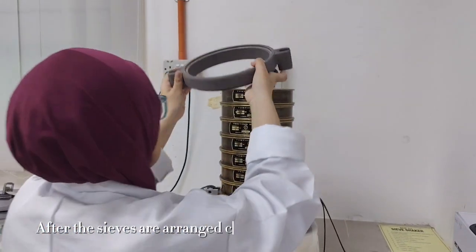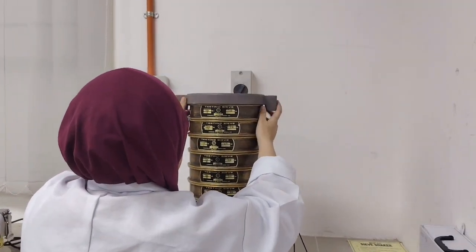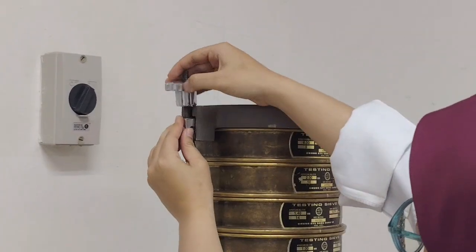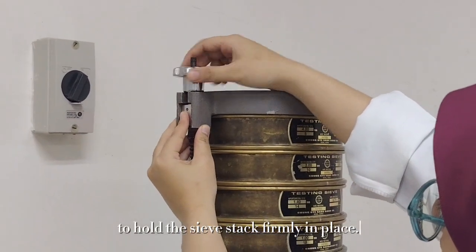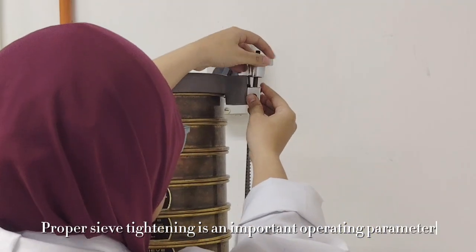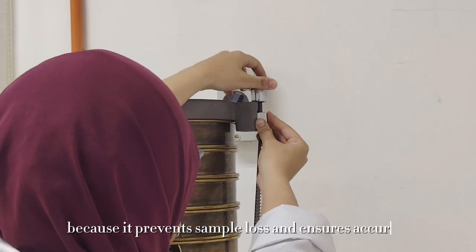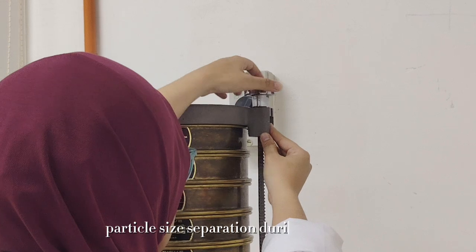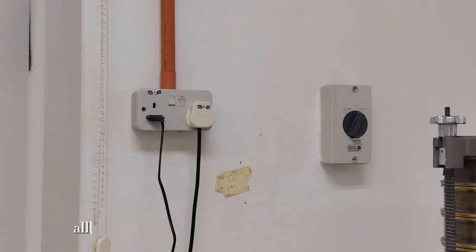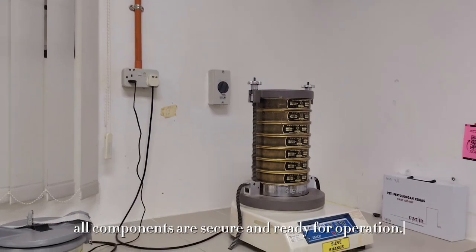After the sieves are arranged correctly, the top cover is placed. The support rods are then secured and the hand wheel is tightened to hold the sieve stack firmly in place. Proper sieve tightening is an important operating parameter because it prevents sample loss and ensures accurate particle size separation during vibration. Finally, the sieve stack is checked to ensure that all components are secure and ready for operation.